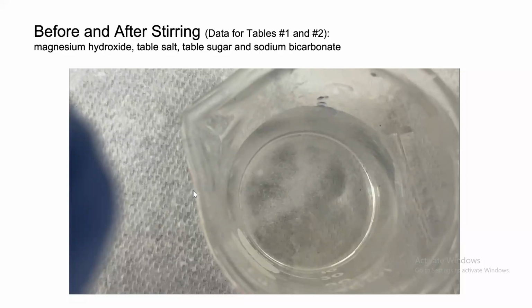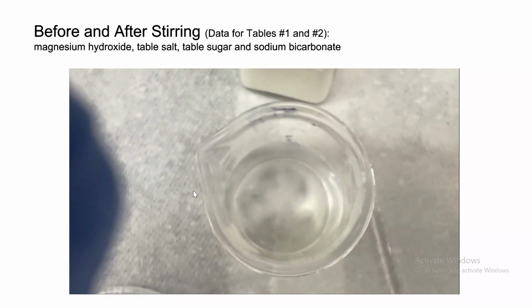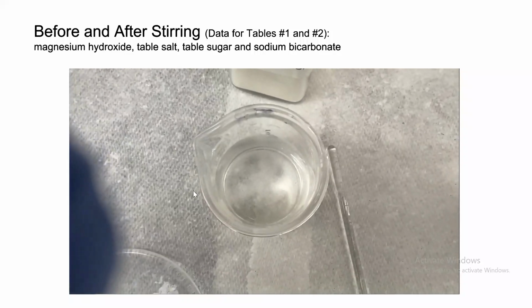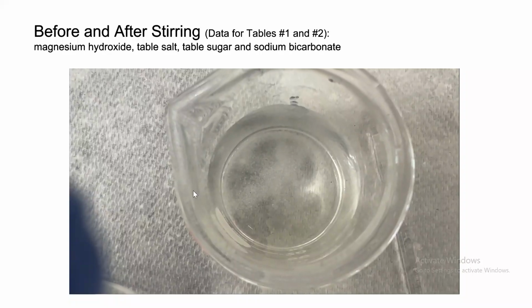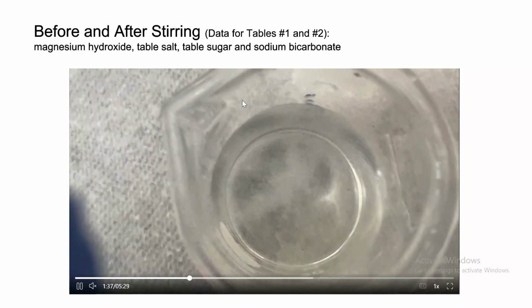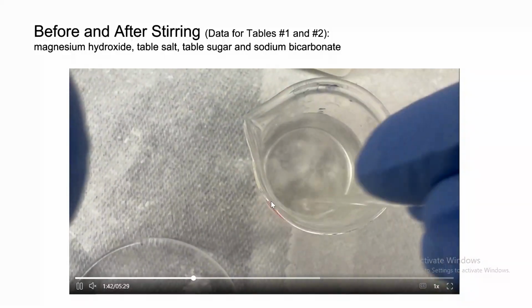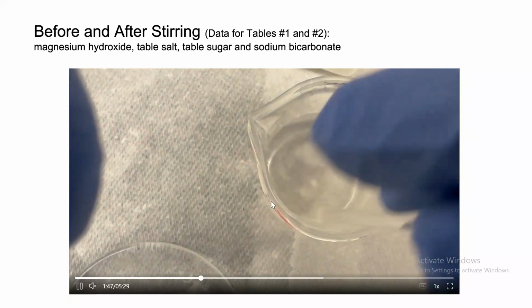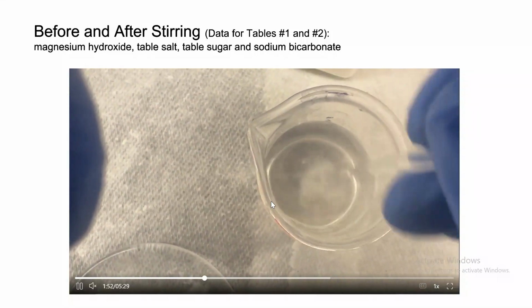So let's stir it now. We're just focusing the camera so you can see it. Here it is. That's the beaker. You can see the salt is all the way at the bottom here. Now we're going to take the stirring rod and stir it. Notice the salt is dissolving. As we are doing it, the salt is dissolving more and more.